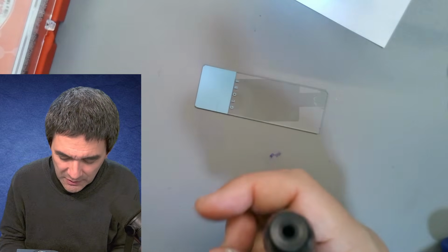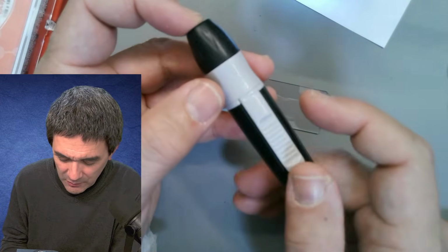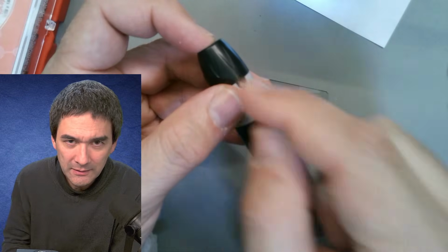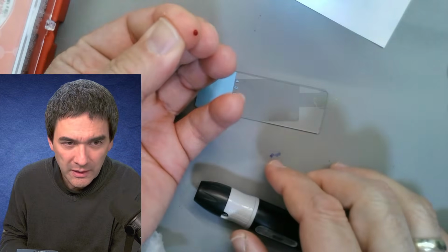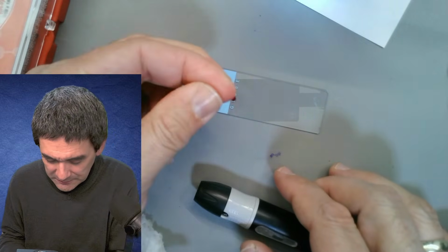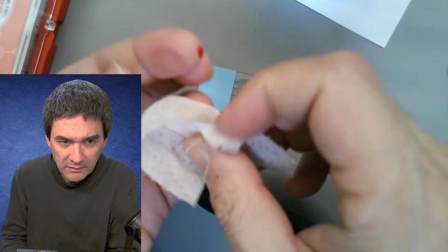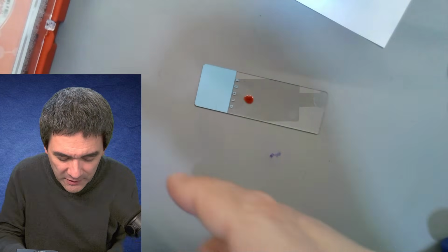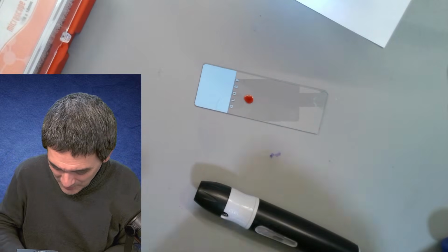I'm going to disinfect myself here again. You put it on here, and then you push this button here, and then it goes ding, and then it shot in. And now I should be able to get a little bit of blood out. Here we go. Okay. So that's it. Disinfect myself again. So much easier psychologically than trying to do this when you actually see it.